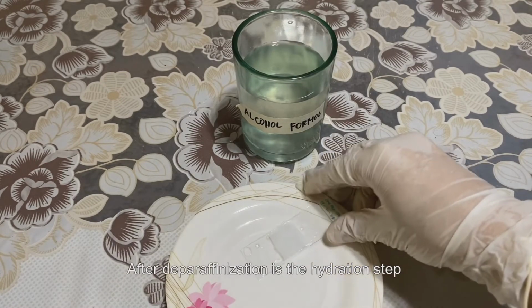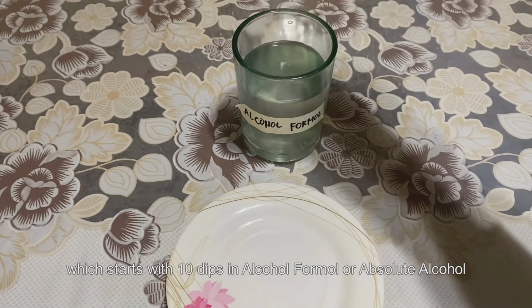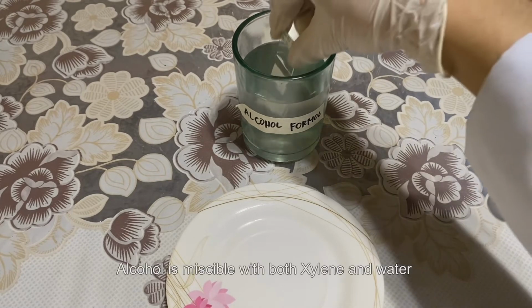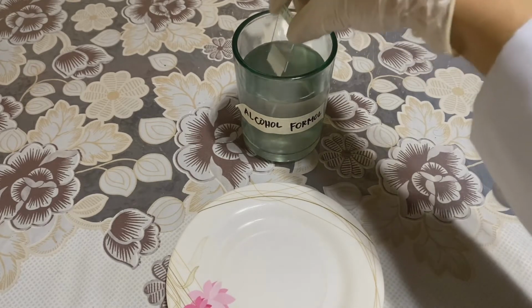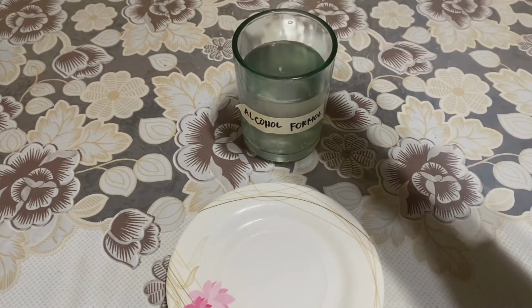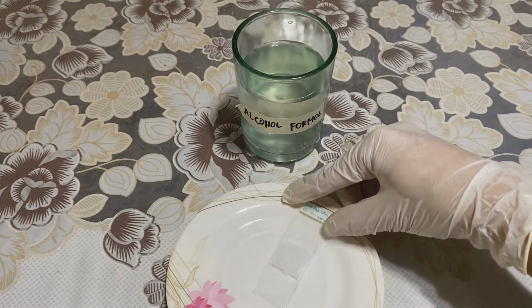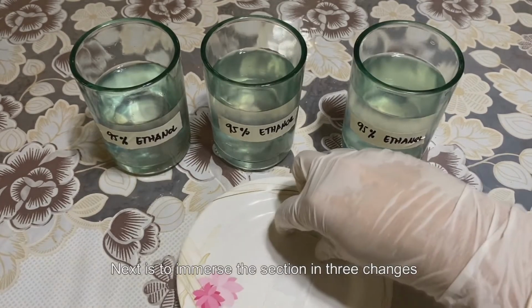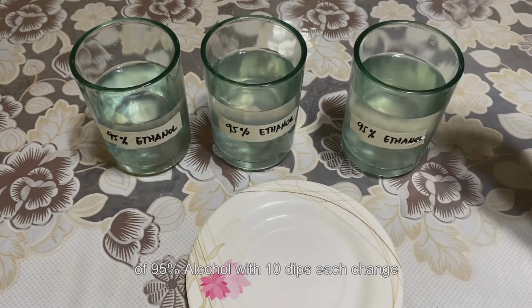After deparaffinization is the hydration step, which starts with 10 dips in alcohol formol or absolute alcohol. Alcohol is miscible with both xylene and water and is therefore effective in removing xylene from the section. Next is to immerse the section in 3 changes of 95% alcohol with 10 dips each change.